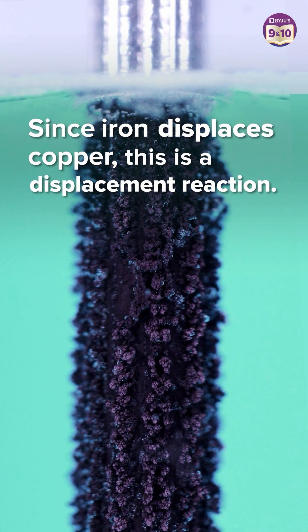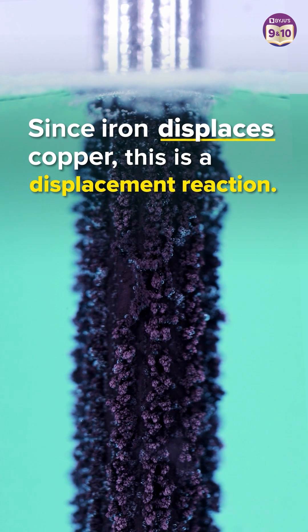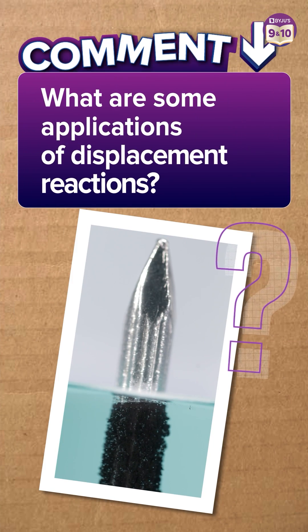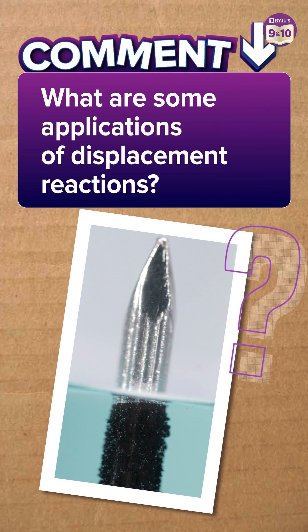Since iron displaces copper, this reaction is called a displacement reaction. Comment and let us know what are some applications of displacement reactions.